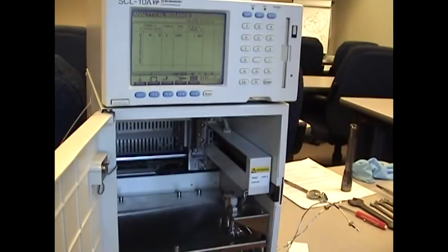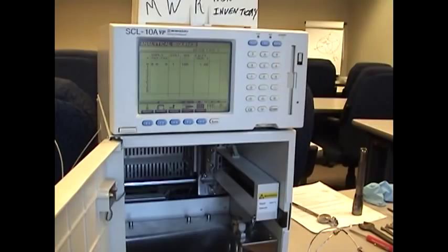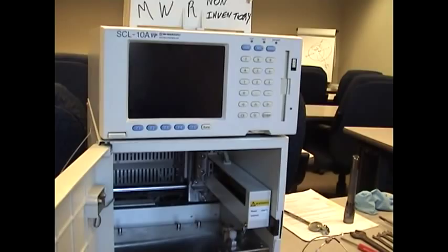Now before you continue, you want to repower. Notice the screen still has the additional characters on it. You simply want to power it off and then power it on again, standard and normal. And it will run as it normally does outside of the service mode.